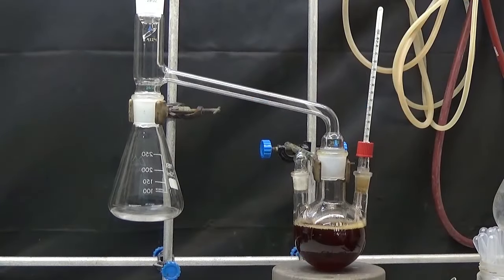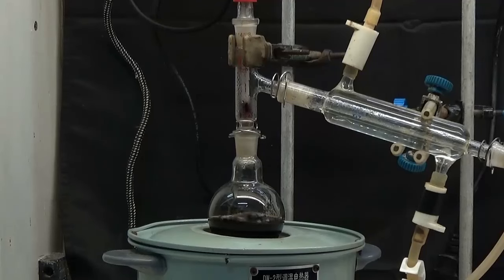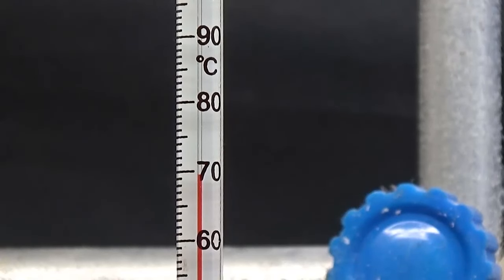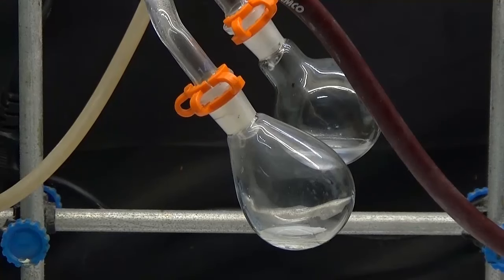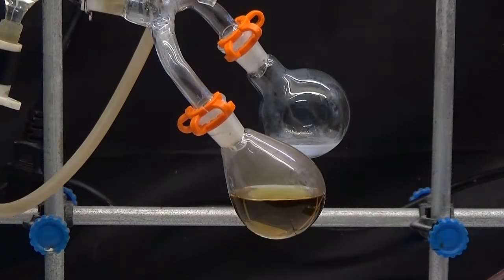We distill until the liquid is at 95 degrees. The remaining liquid in the flask is distilled, collecting the portion that distills between 165 and 170 degrees, which is the boiling point of furfuryl alcohol. Furfuryl alcohol is water-soluble and 0.5 to 1 percent urea should be added for storage.